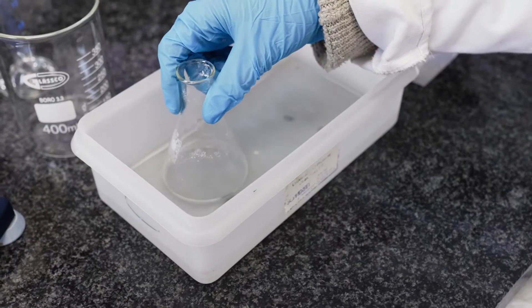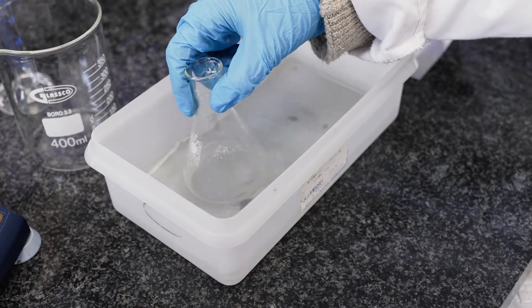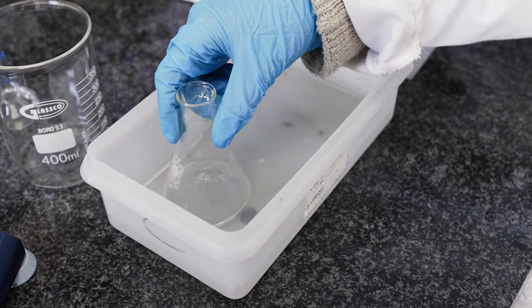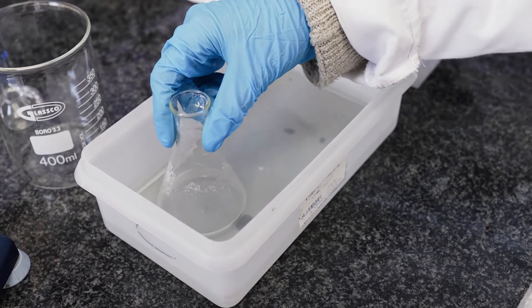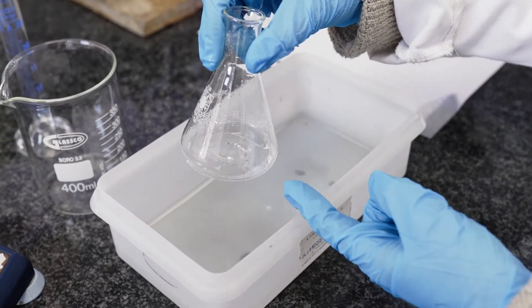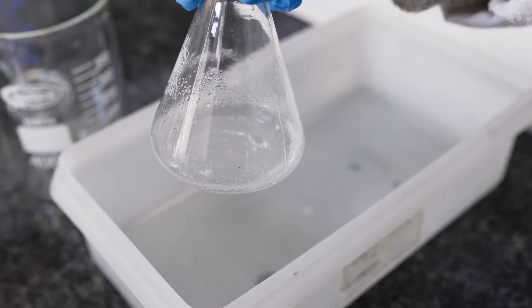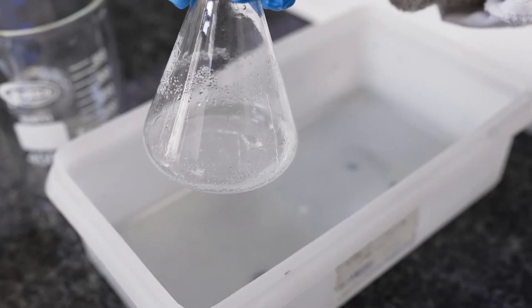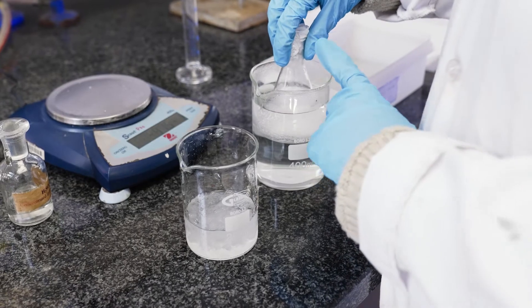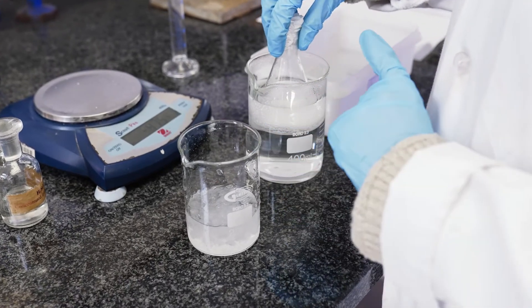We have to wait until everything is dissolved. A way to make sure that everything is dissolved is that the liquid will be clear and you can confirm there aren't any crystals lying at the bottom. Once we've heated it, we're going to place it over into an ice bath.